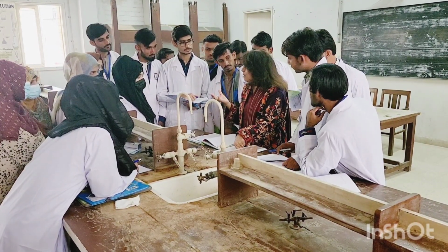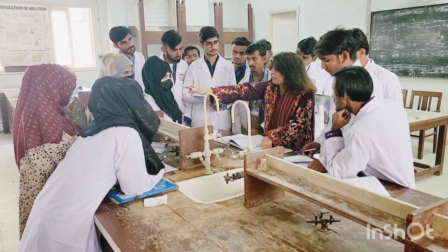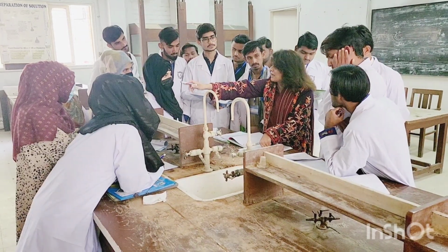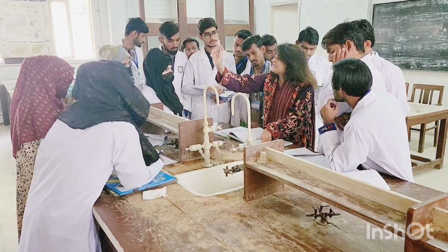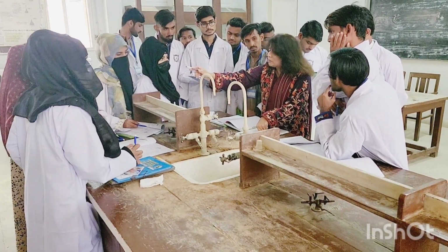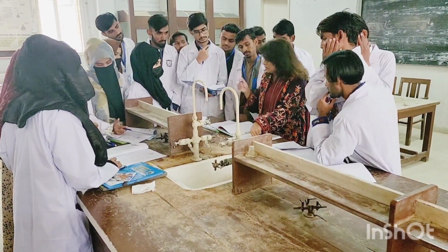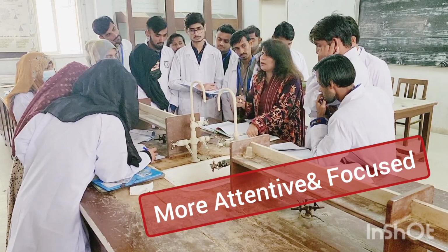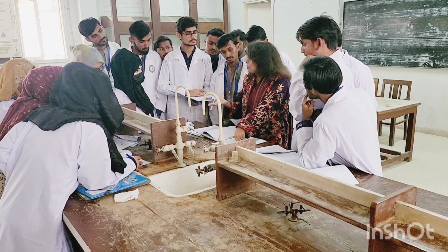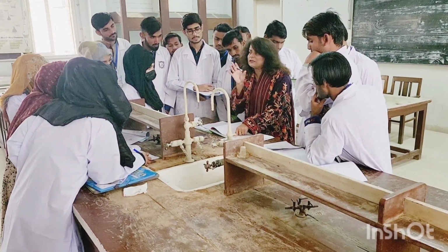On what step are we? What step are we doing right now? What is the heading of our test we are doing right now? Step number 1. Loudly. Preliminary examination. So it's a very initial examination, and when we are going through any initial steps of any experimental process, we are not sure about the results. So we write it with this phrase: it may be present.